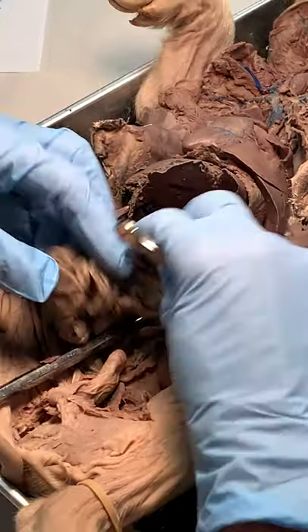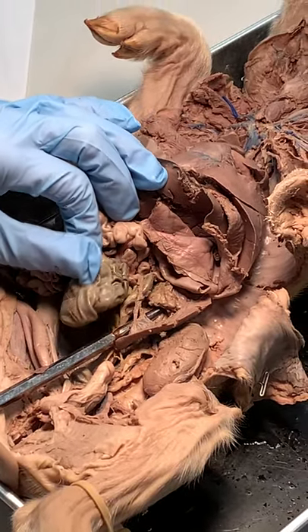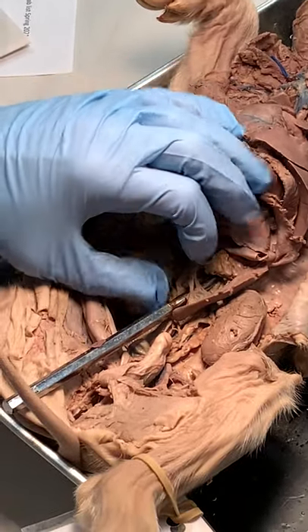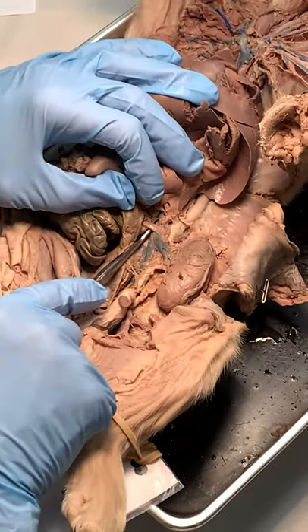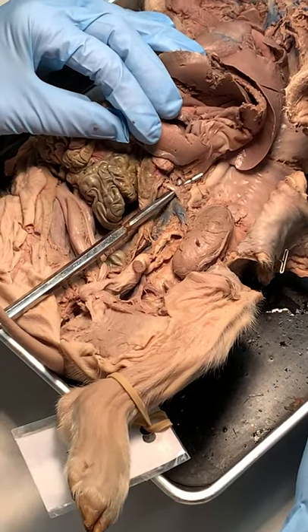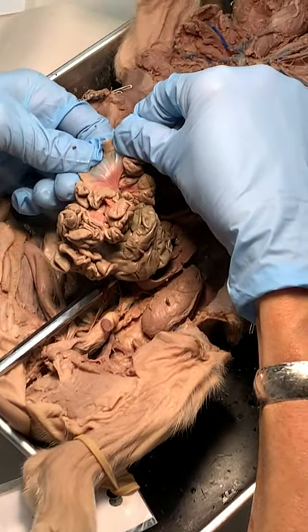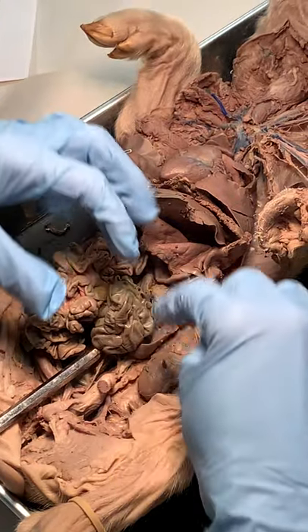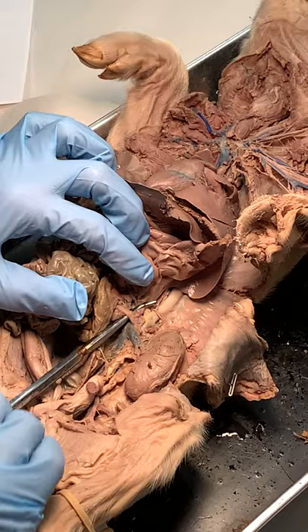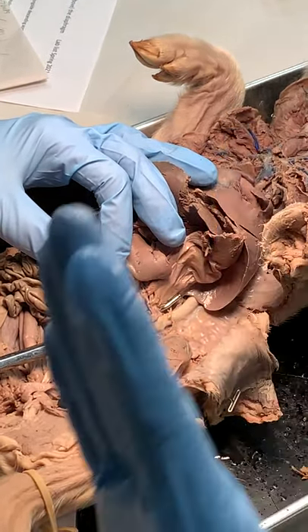The next one down — the next thing I can see is the small intestine. I'm going to feed the spiral colon and then the duodenum. Just think: small intestines is next. This branch here is the anterior mesenteric. The mesenteric — remember it was that clear stuff? All those little red things, those are the arcades, all those little branches, those fans that go feed the intestines — they come from the anterior mesenteric.